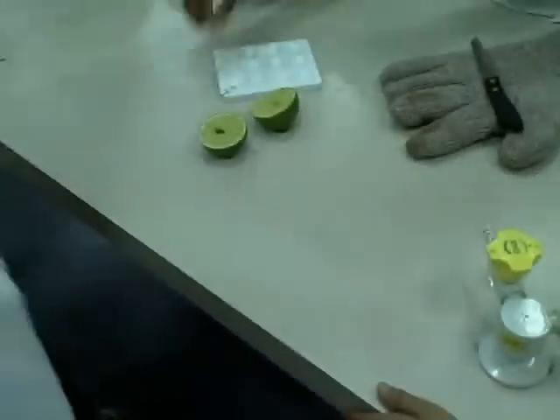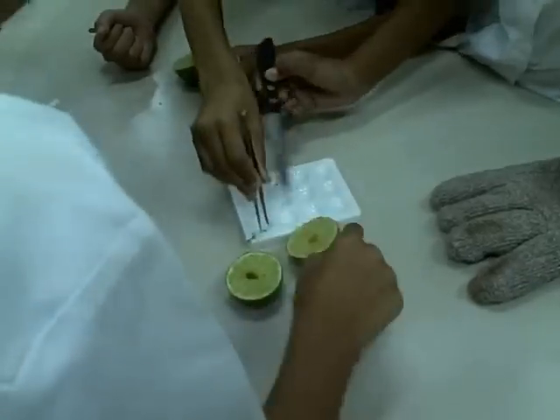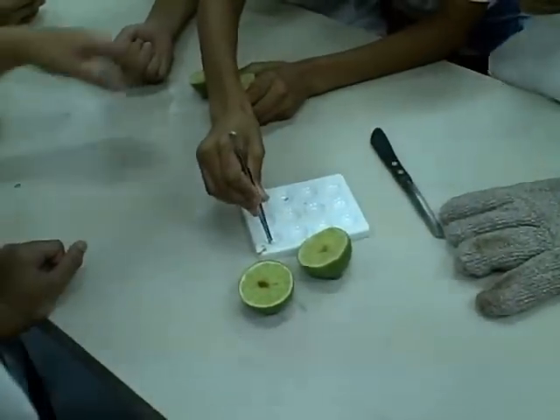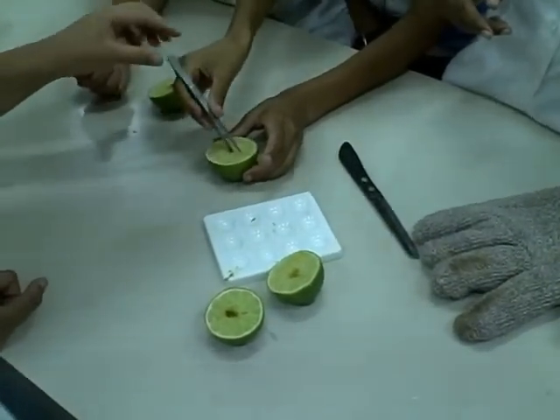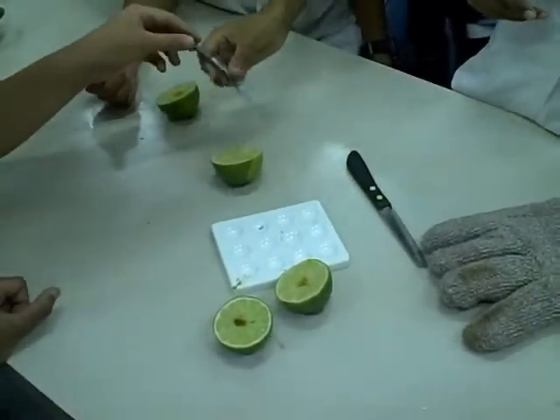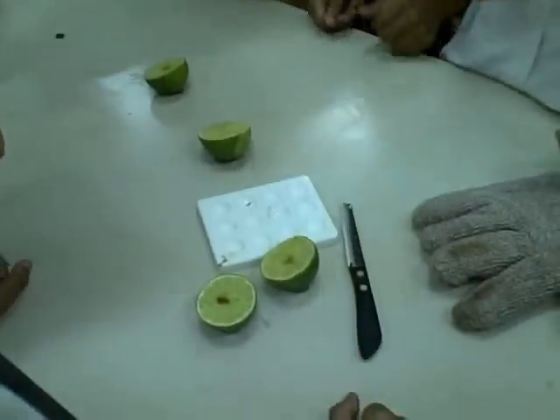Wait, no! Wait, is it in there yet? It is. Wait, give me it. Wait, push it in. No, don't do it. Wait, let's touch it. Put it in. Let's go. Oh, it's not that strong right now. What happened? Yeah, done. Then, one, two, three.